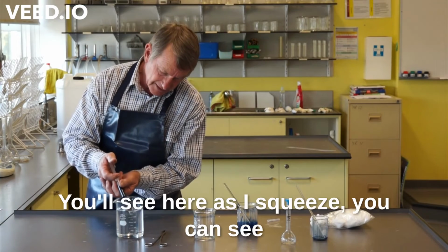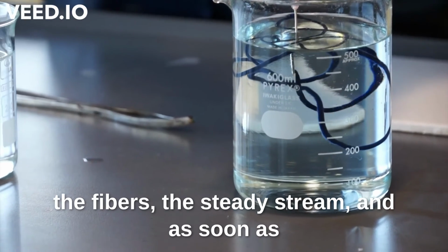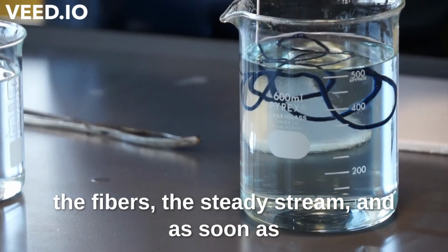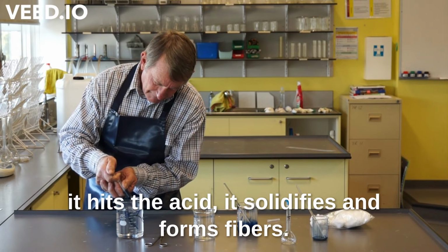Now you'll see here, as I squeeze, you can see the fibres, this steady stream, and as soon as it hits the acid, it solidifies and forms fibres.